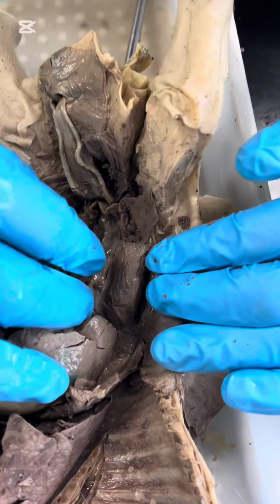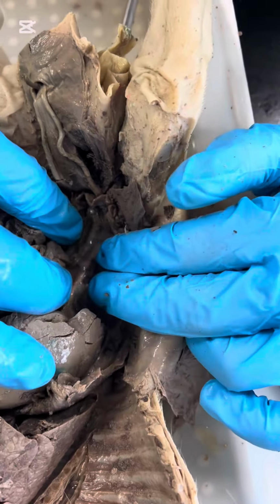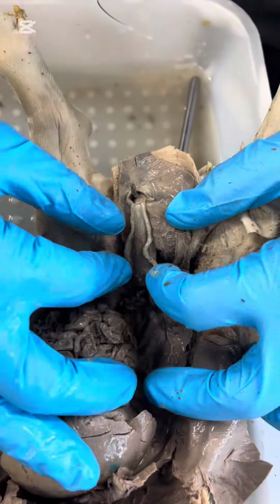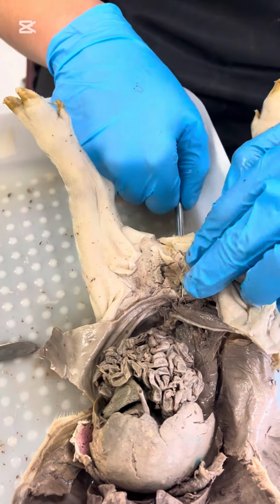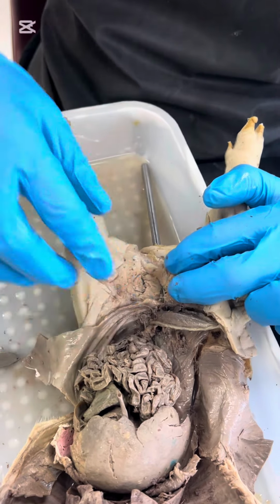So as we peel the intestines aside, right here we can see we have the kidney, and directly beside it we also have the ureter right there. And as we slide down below the ureter, we can also see the bladder right here. So as we've inserted our probe through the genital papilla, we can see that this is the pathway that the urethra opens up into. Okay, on to the respiratory system.